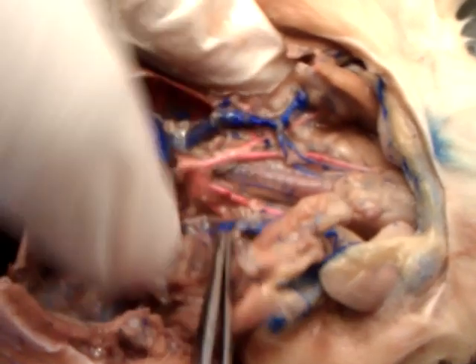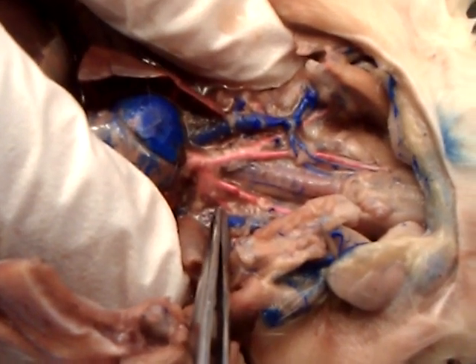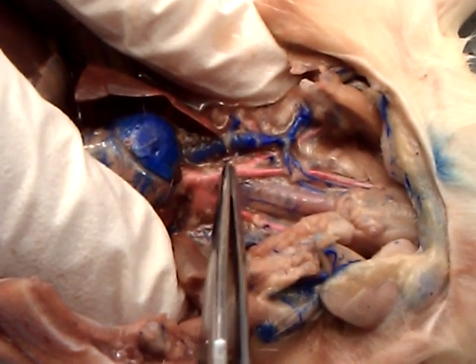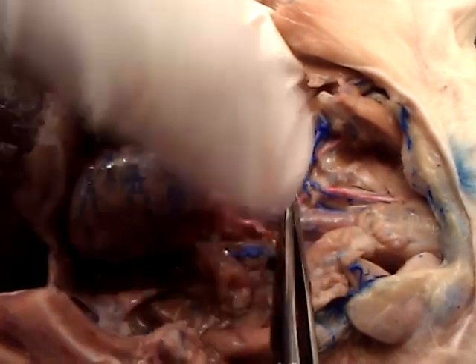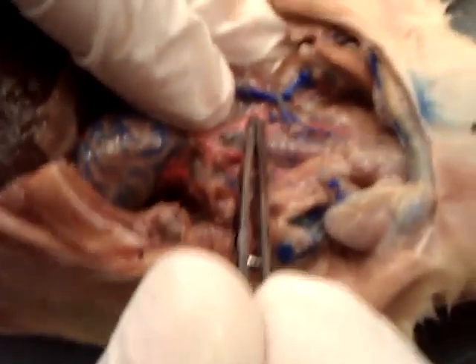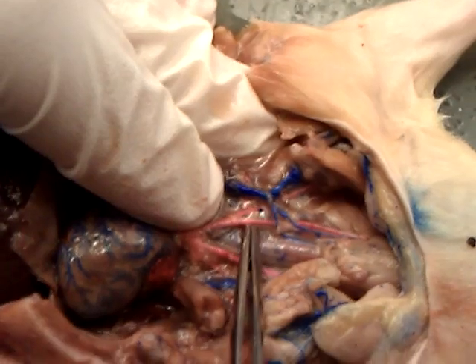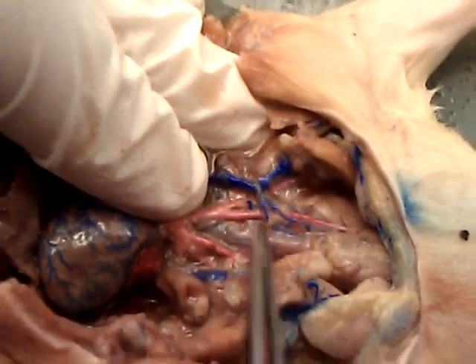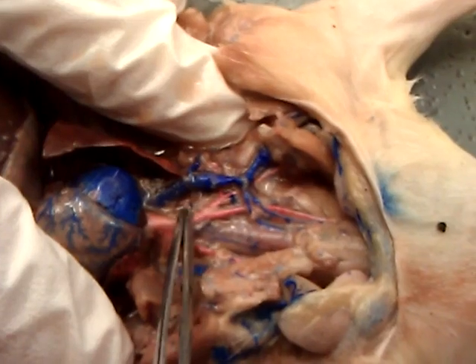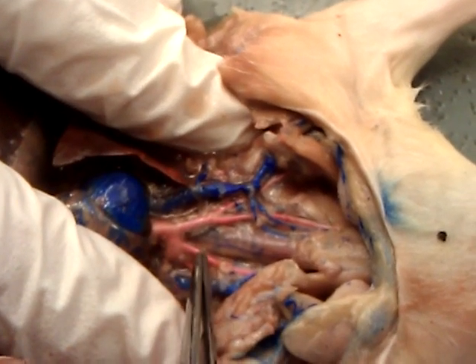So we got aortic arch, left subclavian, left carotid, brachiocephalic. Brachiocephalic comes up here, there's a split into two arteries: this would be the right subclavian and this one would be the right common carotid. So the aortic arch gives: brachiocephalic, right subclavian, right common carotid, left common carotid.